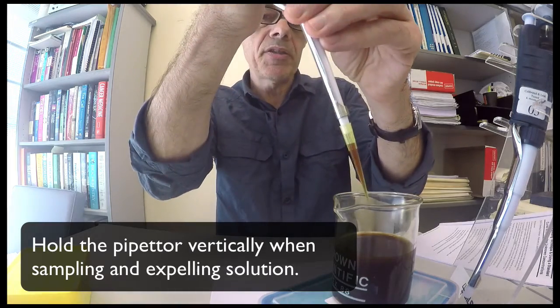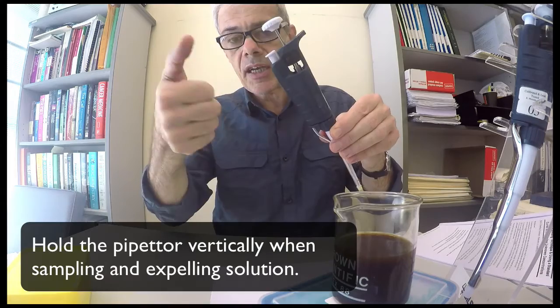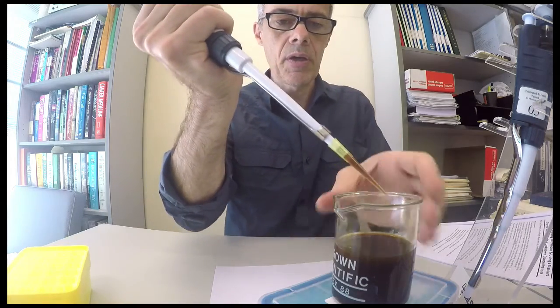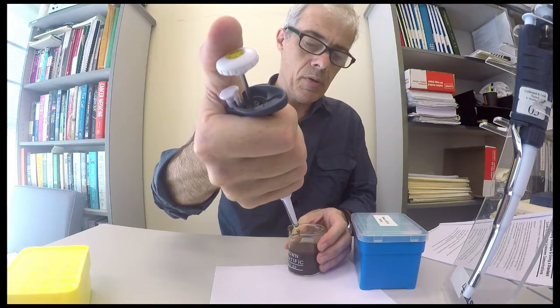If you let me just dispense it. To dispense it I go down all the way to the second position. So I dispense it by going like this. So you'll see here we go.